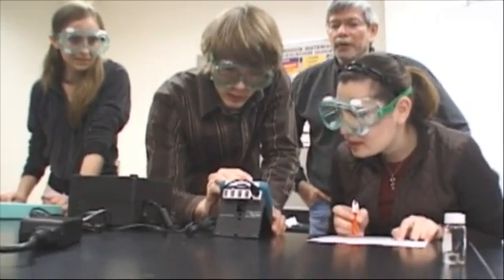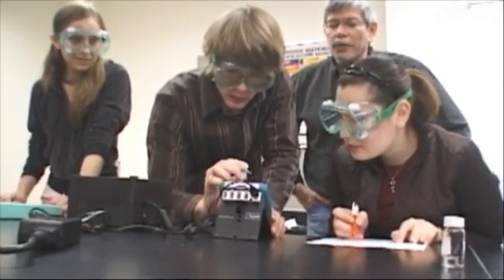Let's take a look at the Mini-GC's features and a few easy steps for getting started. We're here to show you the Vernier Mini-GC gas chromatograph. This gas chromatograph can work either with a computer, Macintosh or Windows, or with our handheld LabQuest interface.